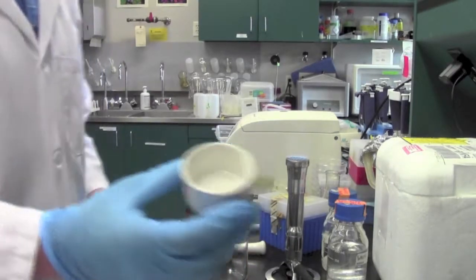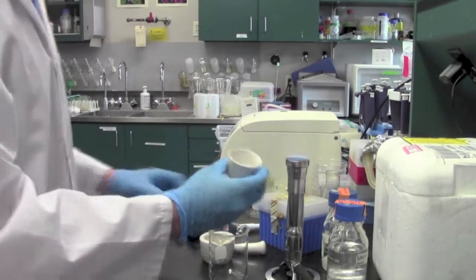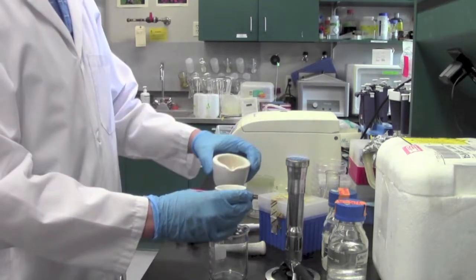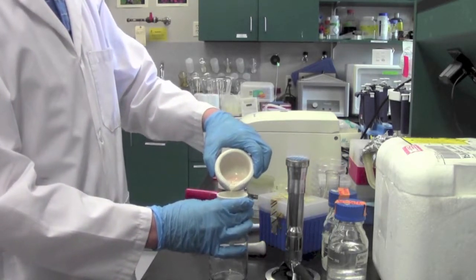So here I am running the chicken and salt buffer mixture through a macro filter to get rid of any large pieces of chicken.